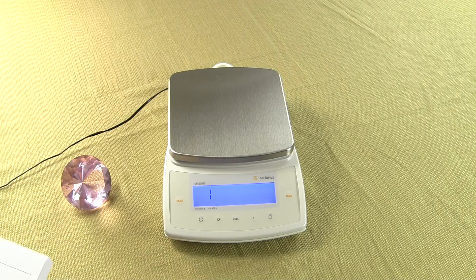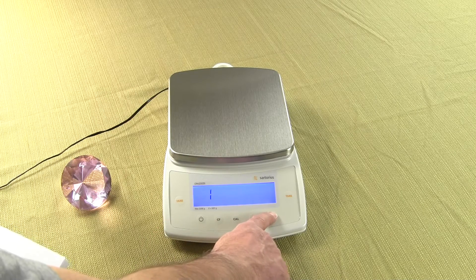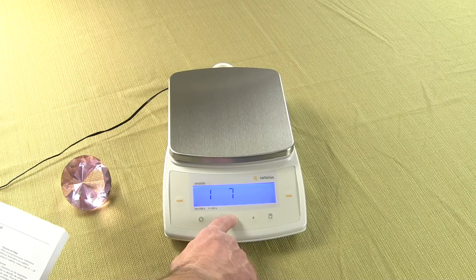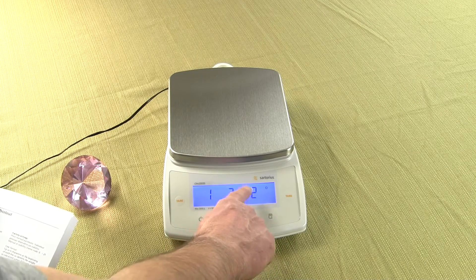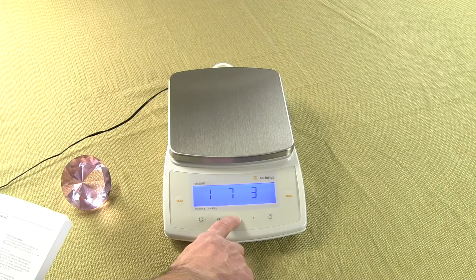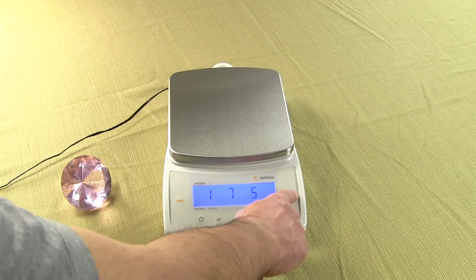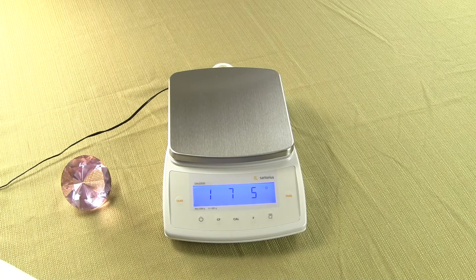To do so, we need to move the cursor over — press the Print key. We want 1, 7; now press the Cal key: 1, 7. Hold the Print key down once. We have 1, 7, 2 — we want to change this to 1, 7, 5 for pounds, so we increment up. We need to store it by pressing the tare key.